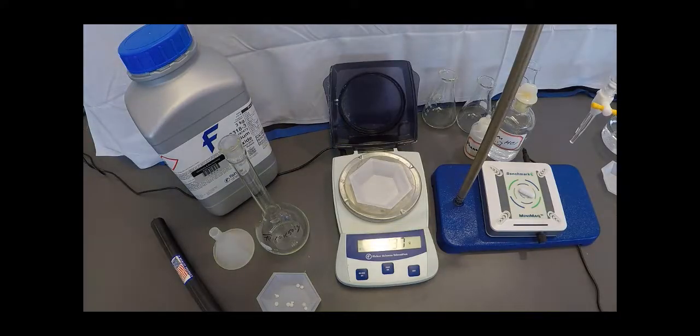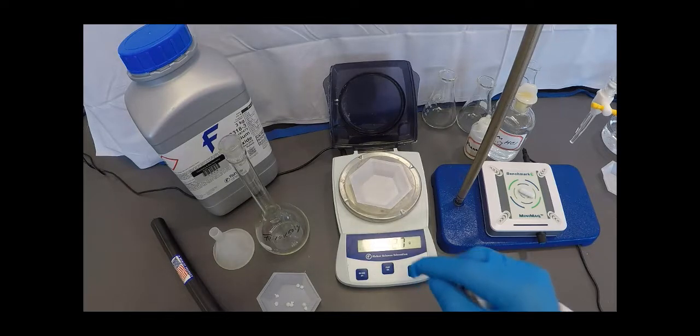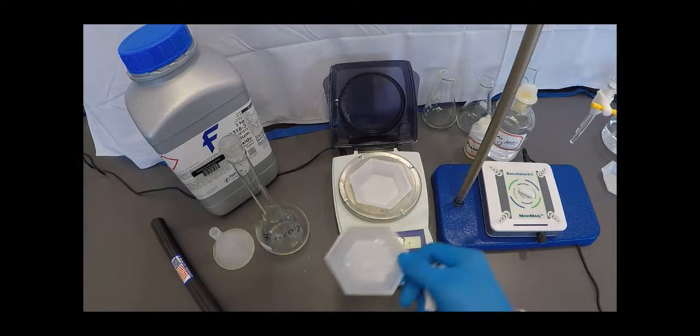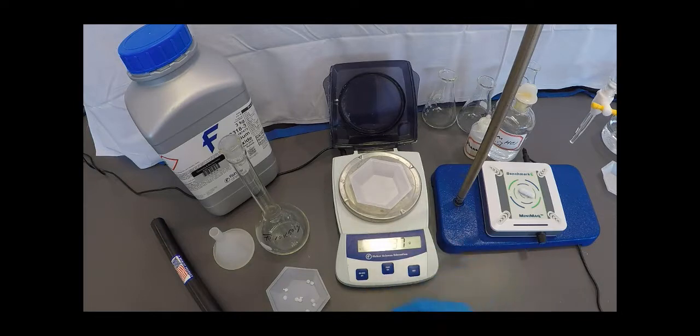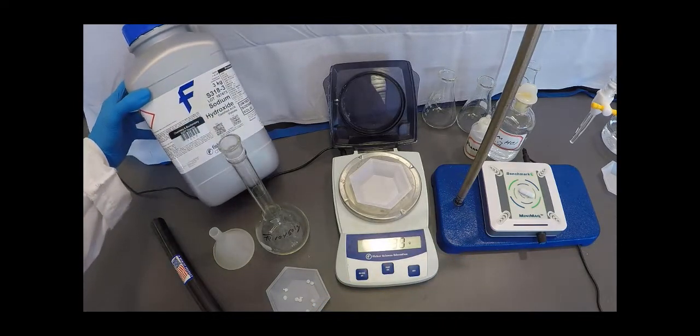For the first portion of today's lab, I'm going to make up an approximately 0.1 molar solution of sodium hydroxide. After I've made up my 0.1 molar solution of sodium hydroxide, I'm actually going to standardize it and the reason is because I cannot get the exact mass of sodium hydroxide due to the fact that it's a very hygroscopic solid and what that means is that it takes up moisture out of the air pretty much as soon as I remove it from the commercially available container.